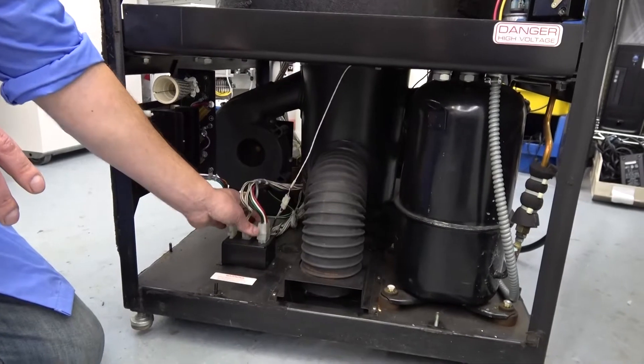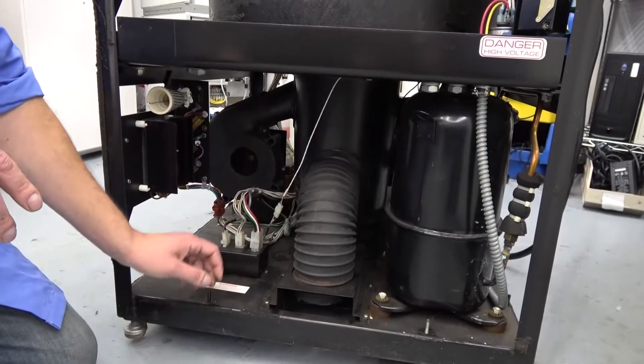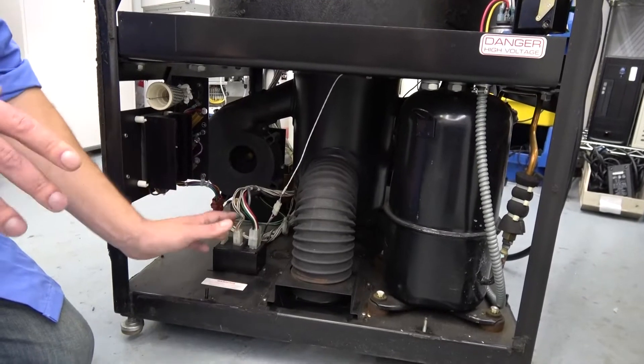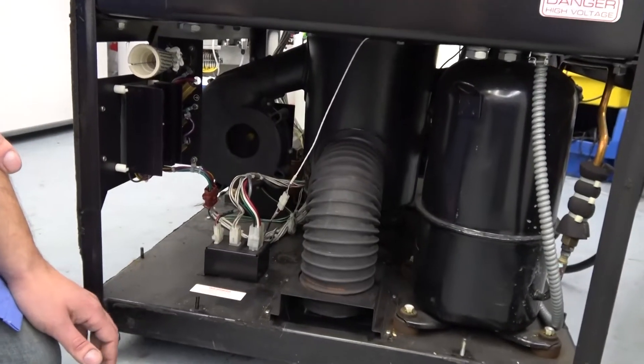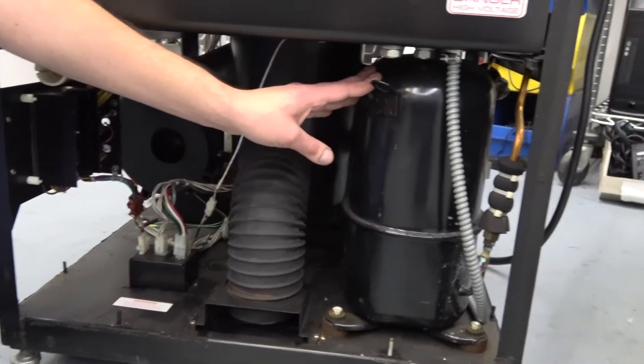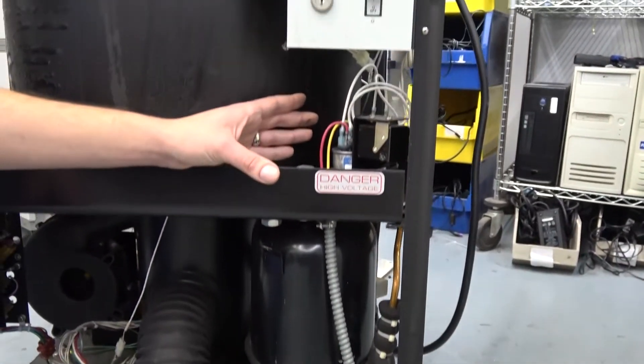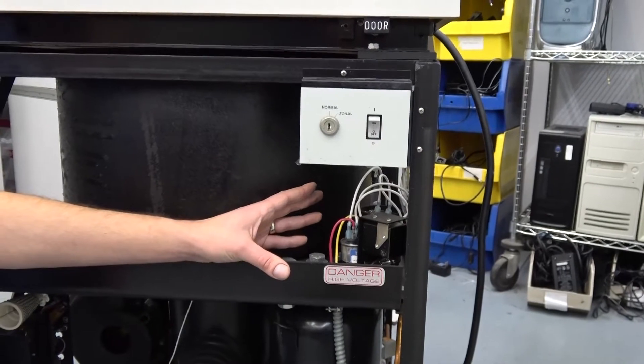You have different wiring configurations depending on what type of motor you have — two tachometers, one tachometer, the age — it all kind of varies. You have your compressor, it's a big thing. Above it you have the start capacitor and the relay.